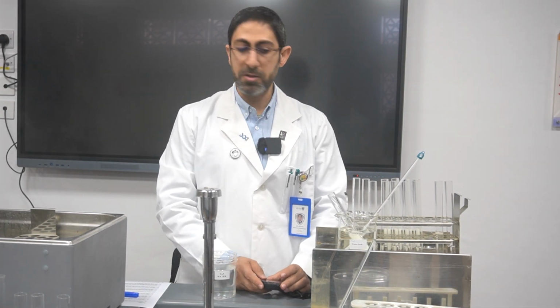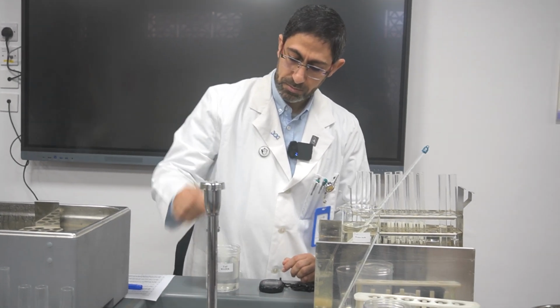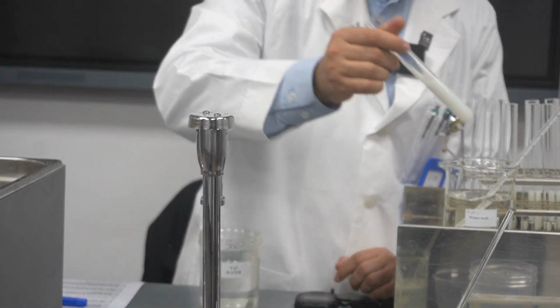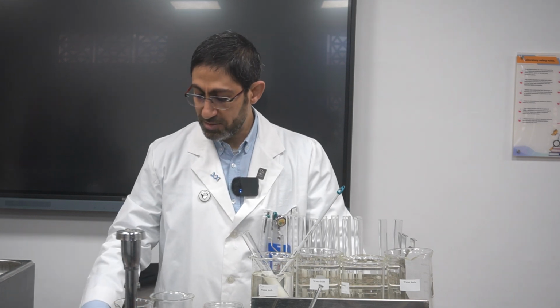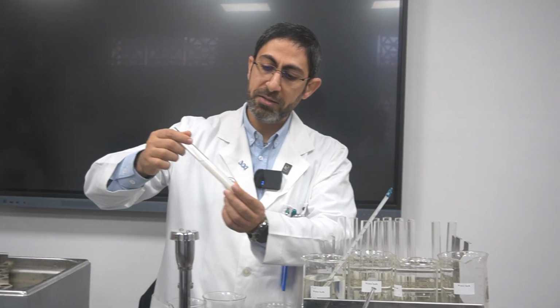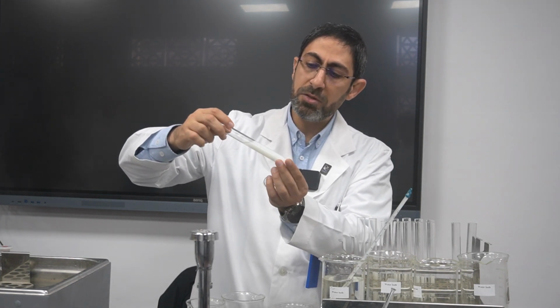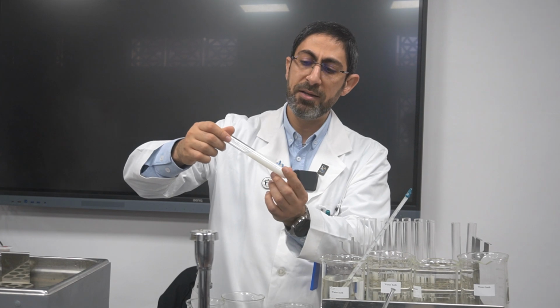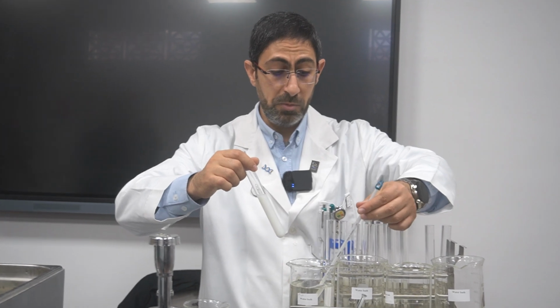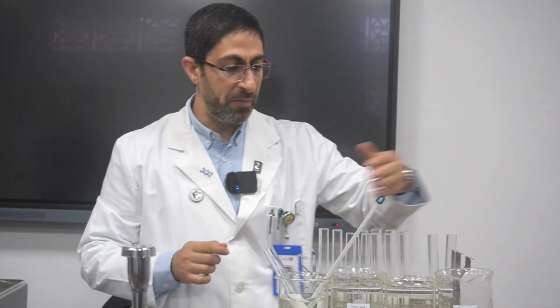We still need to wait for about 20 minutes, and every 3 minutes thoroughly mix them. After 20 minutes, I actually noticed that the end point here is after 20 minutes. And it's very, very small clotting, which is indicating that the enzyme started. It's a very slow reaction because the temperature is low. It is 20, not the optimal temperature for the enzyme to work. Now I'm going to move to the other temperatures.